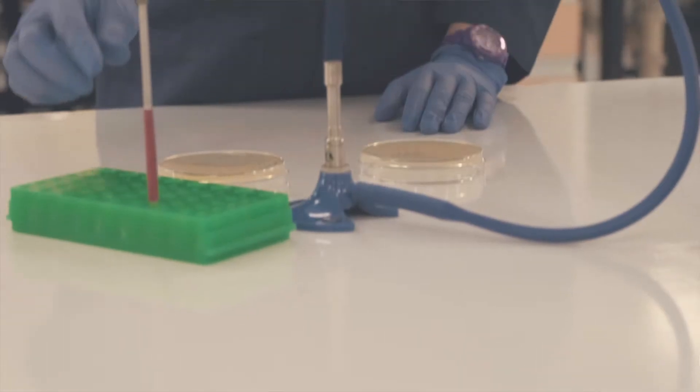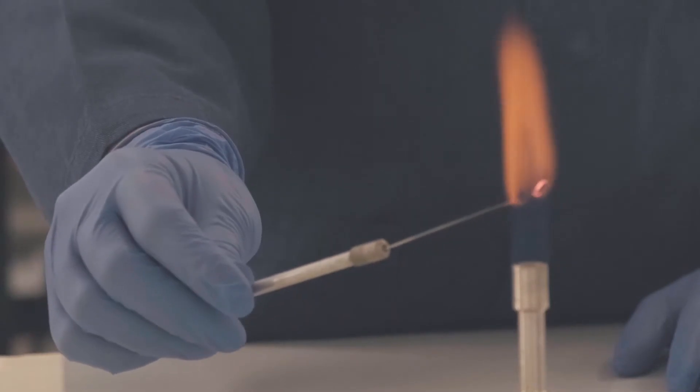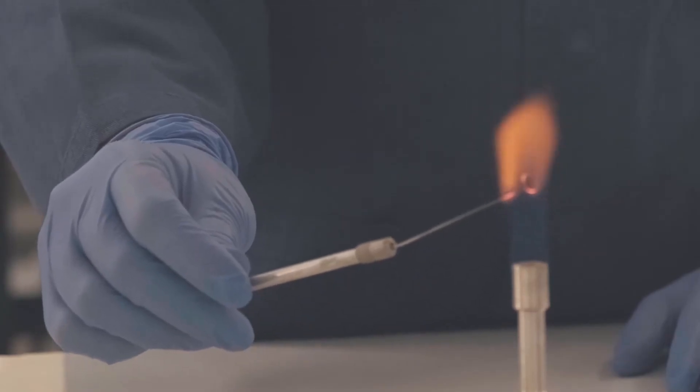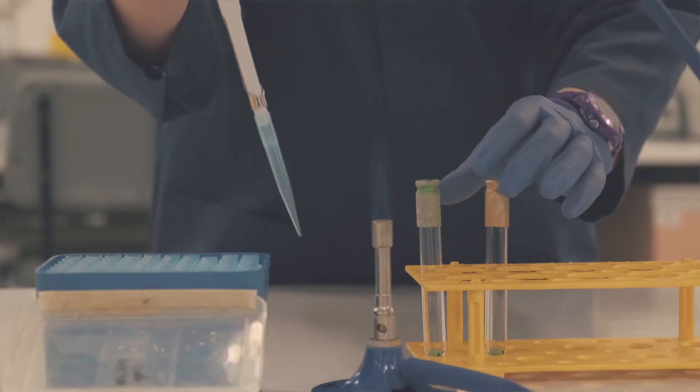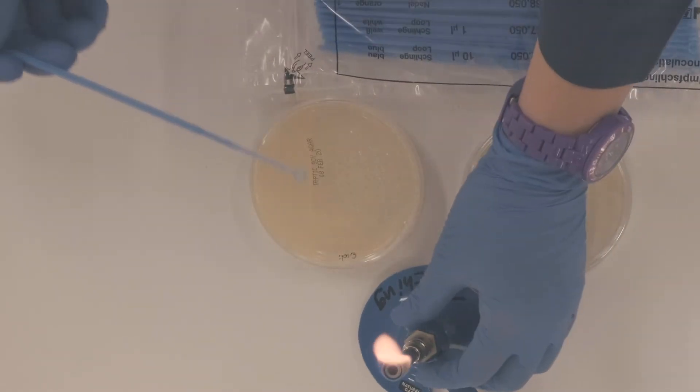We can use metal loops that need to be sterilized to transfer biological samples. Hold the metal loop at an angle in the flame until it is glowing hot, then cool it beside the flame for about 10 seconds before use. You can also work with single-use items that have been pre-sterilized, such as pipette tips or spreaders. This is quicker but can be more expensive than a reliable metal loop that you can reuse time and again.